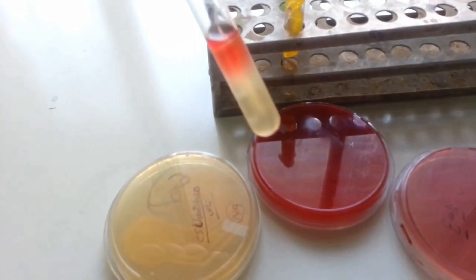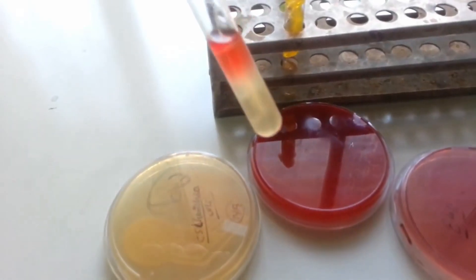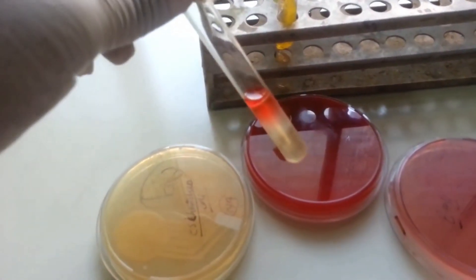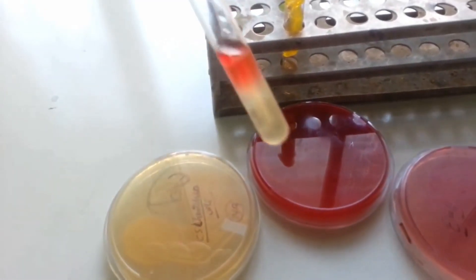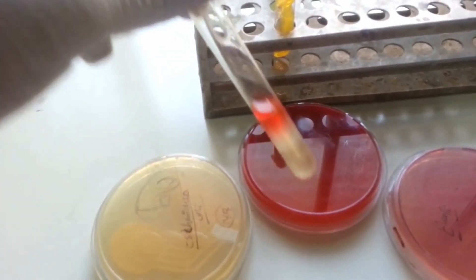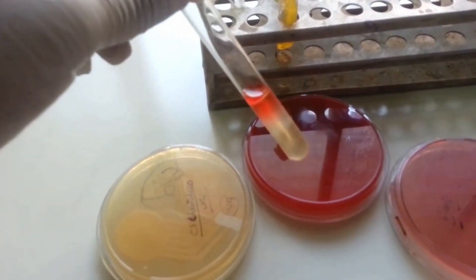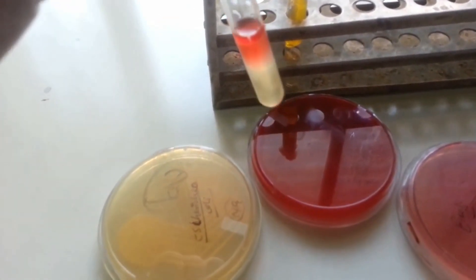Sulfide Indole Motility — in brief, SIM test result: organism is motile because of visible turbidity, no blackening of the medium, hydrogen sulfide negative. After addition of Kovac's reagent, formation of red color compound indicates indole positive.